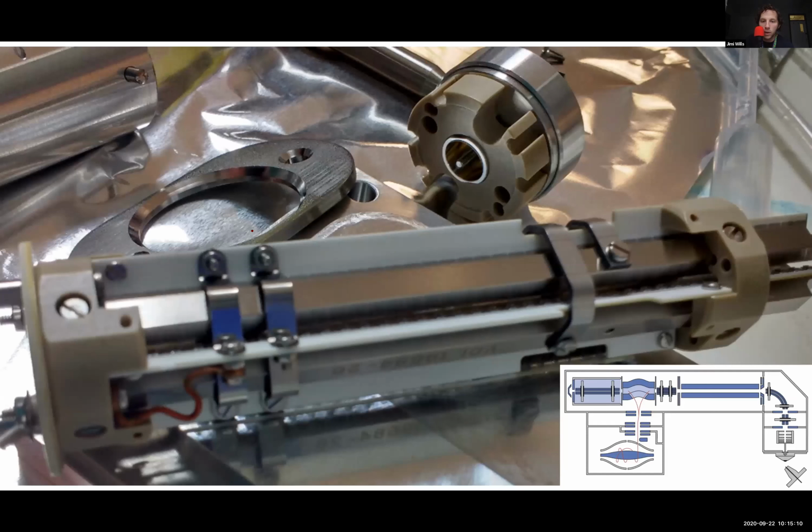It's very rare that we get one of these out of the instrument. In fact, on this occasion, it was because one of the vacuum pumps on the instrument failed and sprayed the inside of the instrument with pump oil, and so everything had to come out and get cleaned. That's really the only time this part would come out, I think.